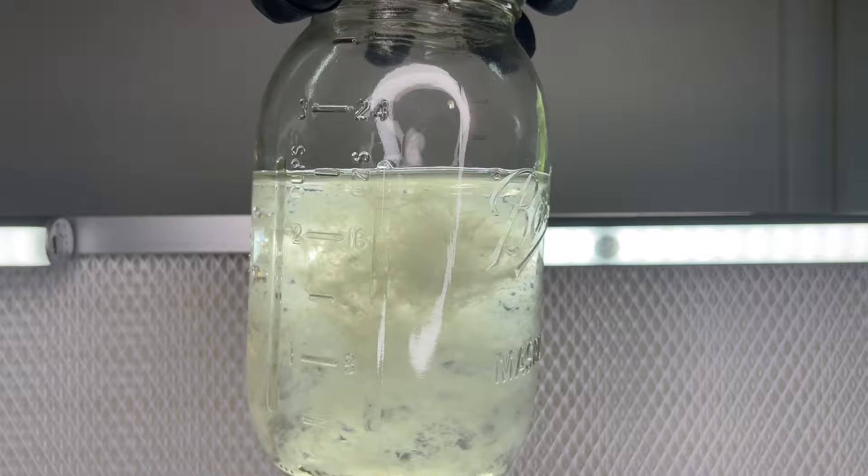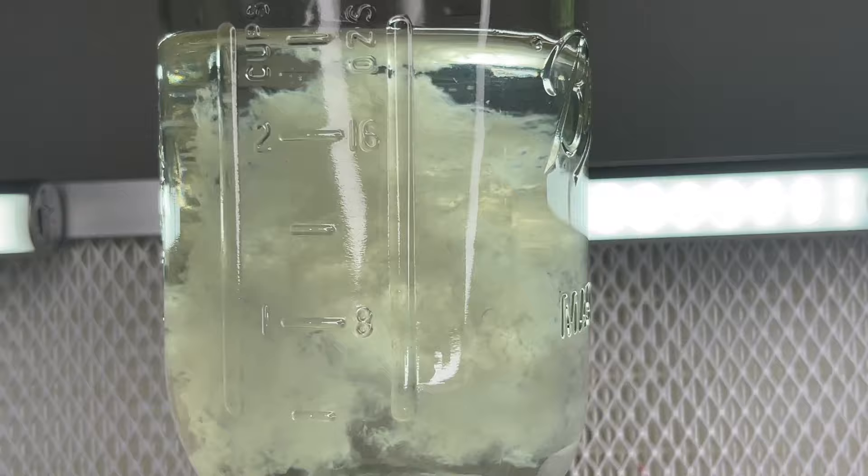When compared to honey, the new recipe is much more consistent from batch to batch. The mycelium will grow faster and more natural looking in a media that is clear and free of sediment or cloudiness.